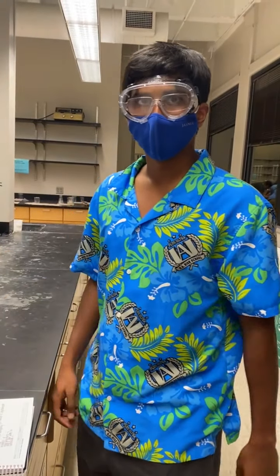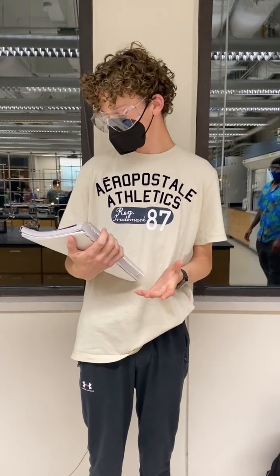So I'm going to be talking about comparing and contrasting quantitative and qualitative data with the spectrophotometer. First I'm going to give two examples of why it's important to read across all wavelengths when using the spectrophotometer. First, if one absorbance or dilution that we look at has a lambda max absorbance of 200 nanometers, and we only look at it from 600 to 800 nanometers, we would miss the lambda max, we might find no absorbance between 600 and 800 nanometers, or we might find a smaller absorbance than the actual lambda max.